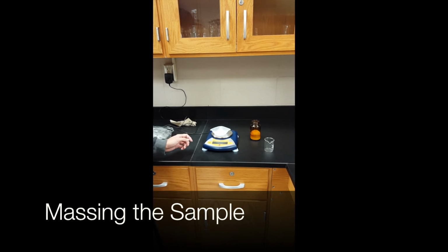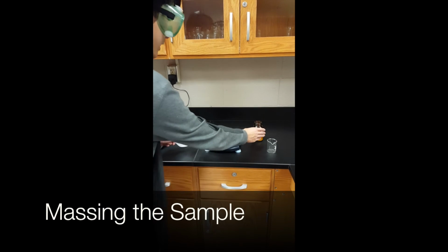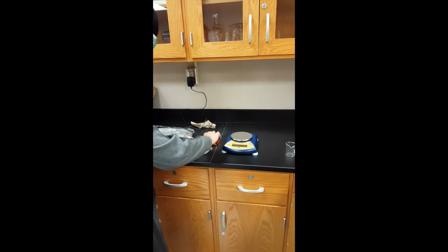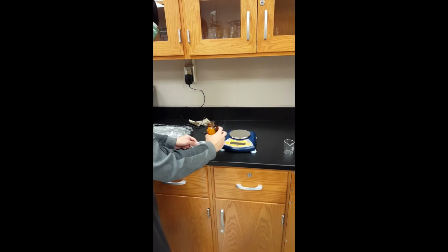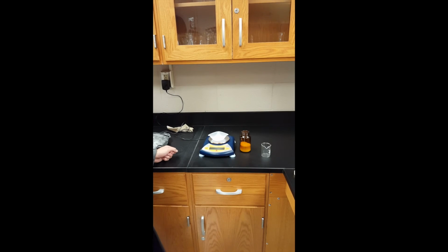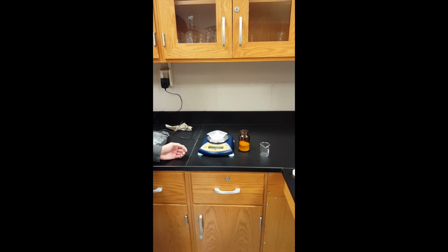Now we are ready to add our sample. Remove the plastic weight boat from the scale. Add your sample to it, in this case sand again. And there we go, that should be good. And simply place the whole thing back onto the scale. Wait for the numbers to stop. And there you go, that's the mass of our sample, 10.22 grams.